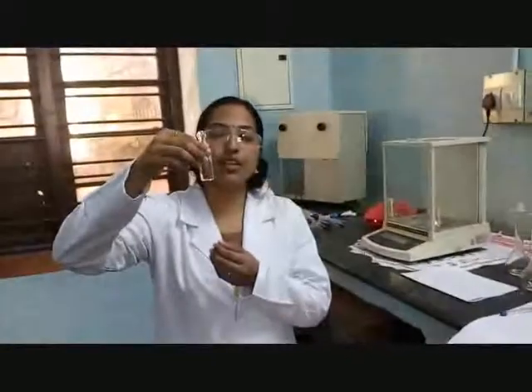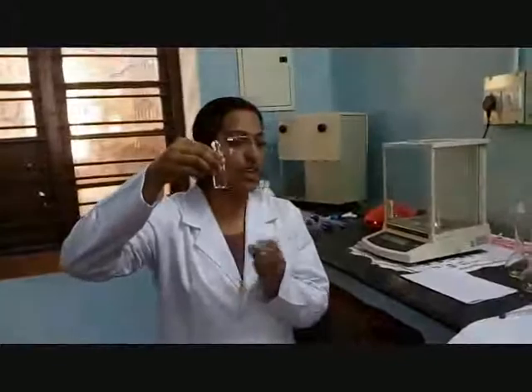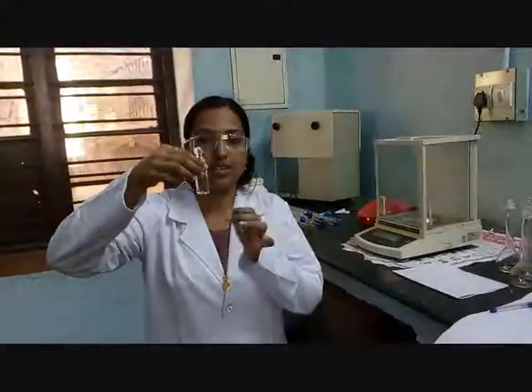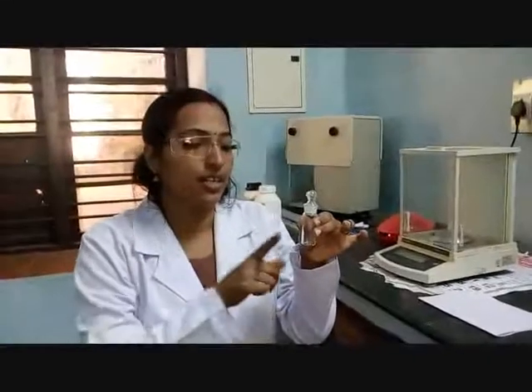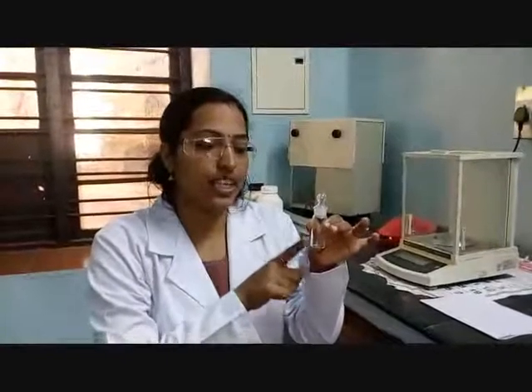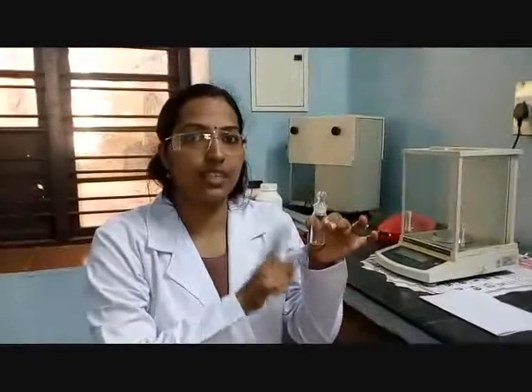This is the weighing bottle used for weighing the primary standard. Before weighing, the weighing bottle should be clean and dry.